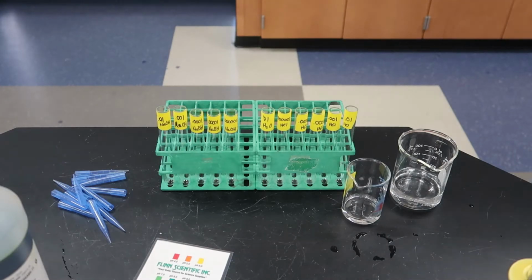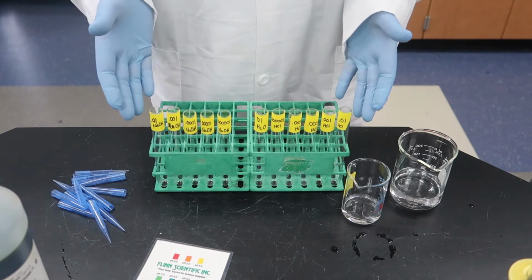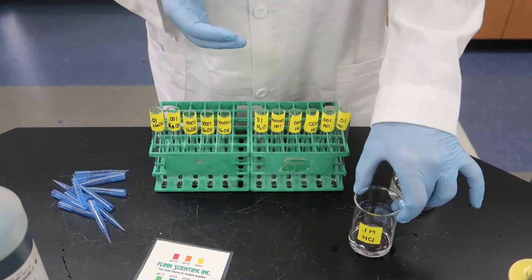Okay, in this demonstration, I have to apologize up front. I was looking at these test tubes with the labels facing forward and did not see which ones are which. So you're going to see I do some things backwards here.